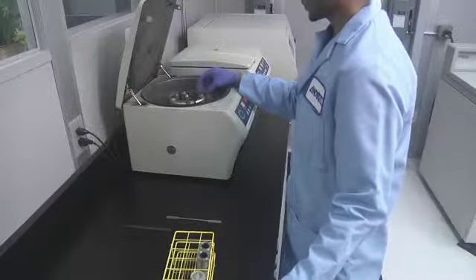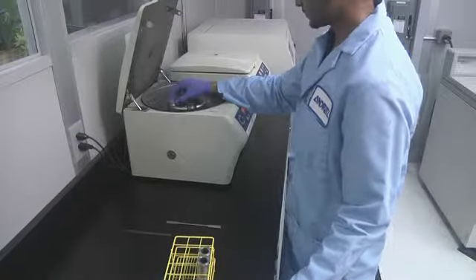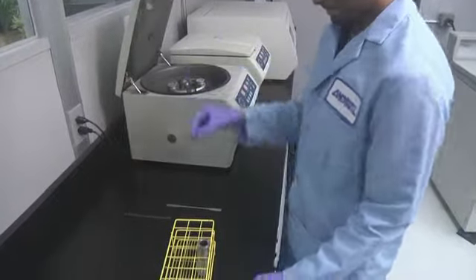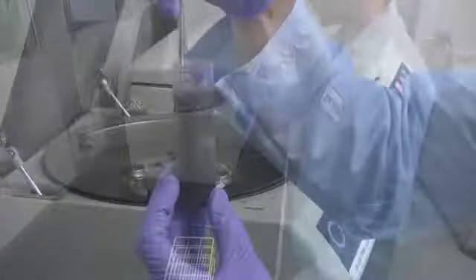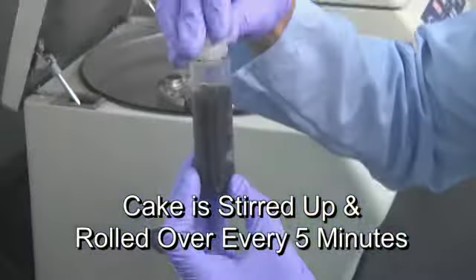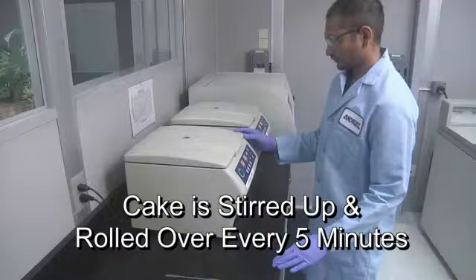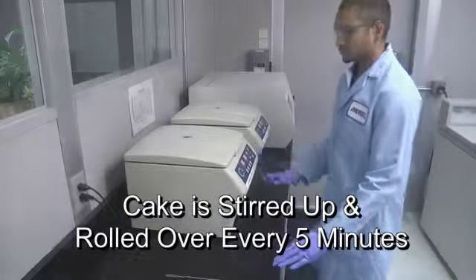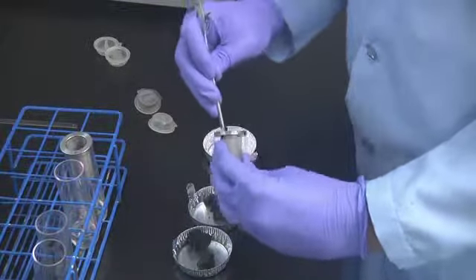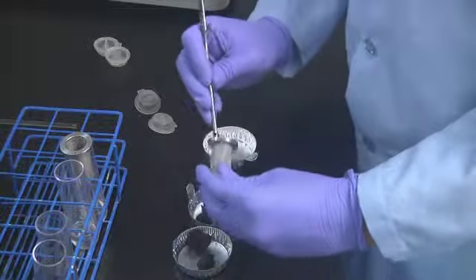The tubes and screen tubes are placed in the laboratory centrifuge at the desired G-force and set at varying spin times. To simulate the action inside a full-scale decanter, the cake inside the screen tubes is stirred up and rolled over every 5 minutes. After centrifugation, the solids in the tubes and screen tubes are removed for solids analysis.